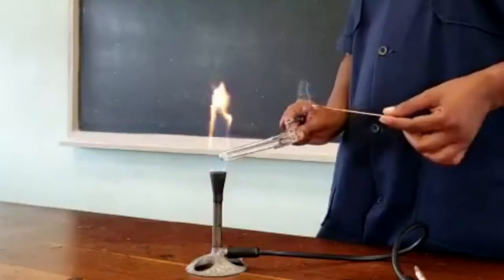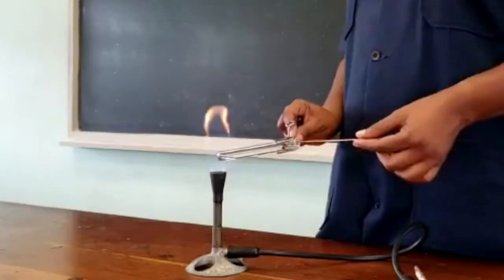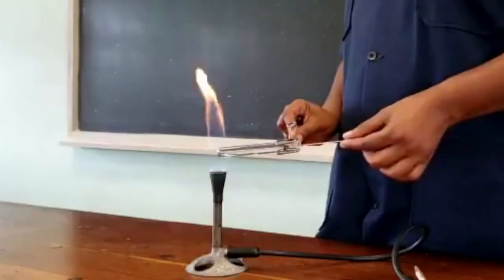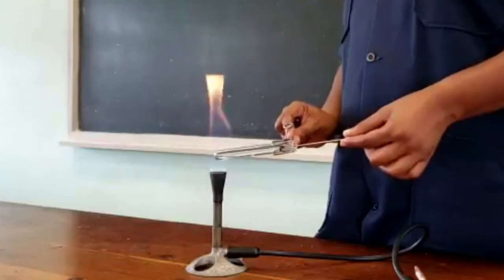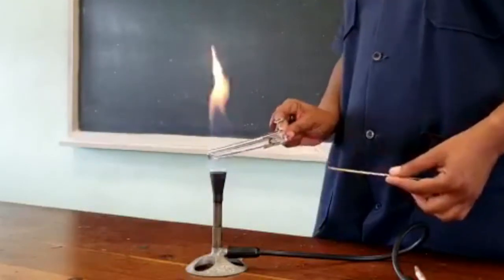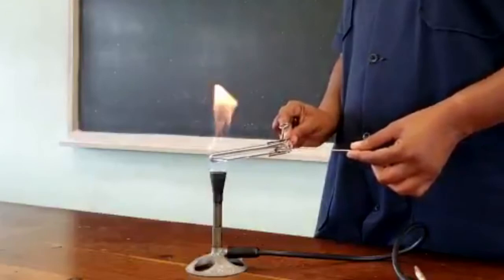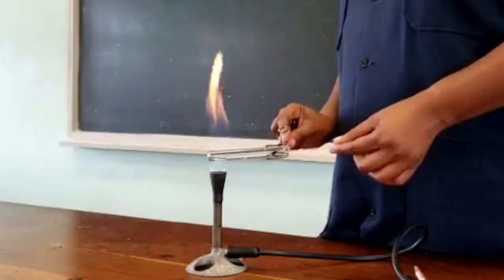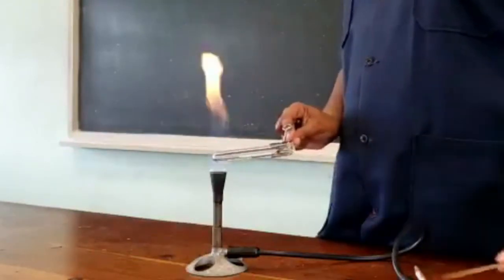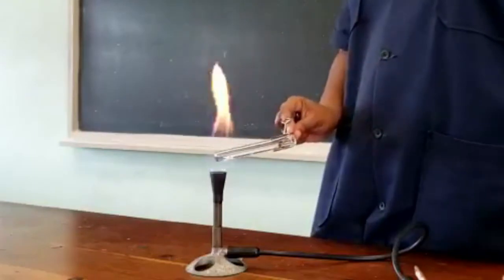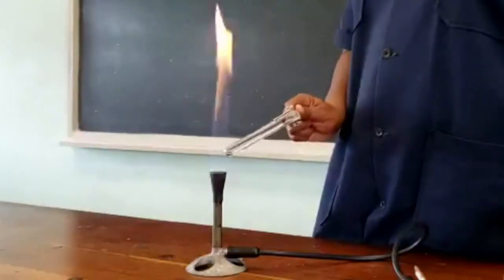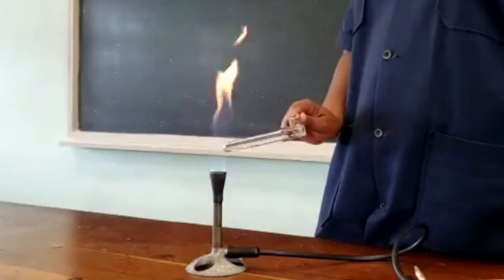Now we're using our glowing splint so you can see. It's getting quite hot, I don't want to burn my hand.